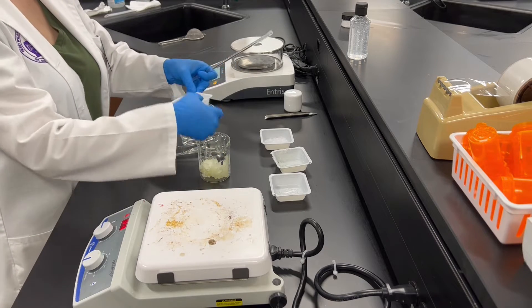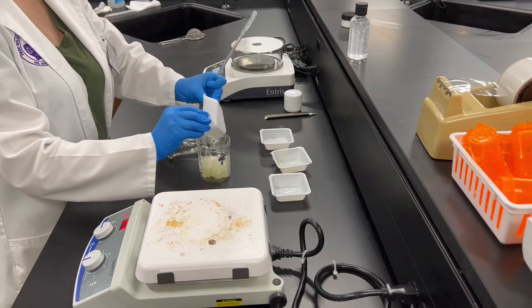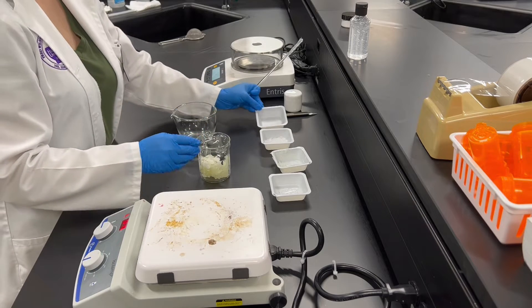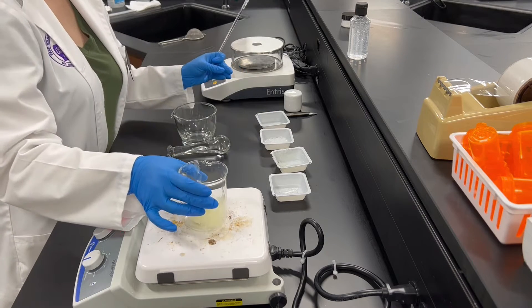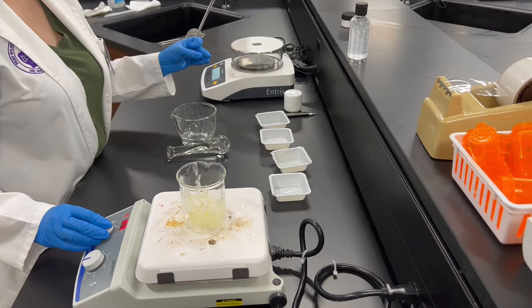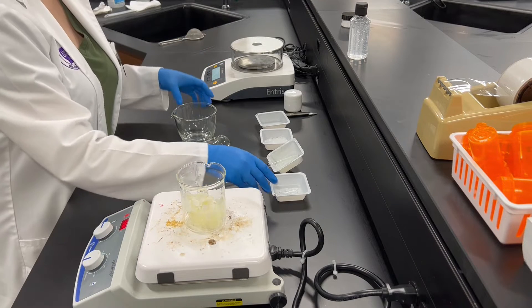The first thing you're going to do is go ahead and put your petroleum jelly and your wax into a beaker, and then you're going to turn your hot plate on and put this beaker onto the hot plate. You do not need to put a stir bar in with this today.